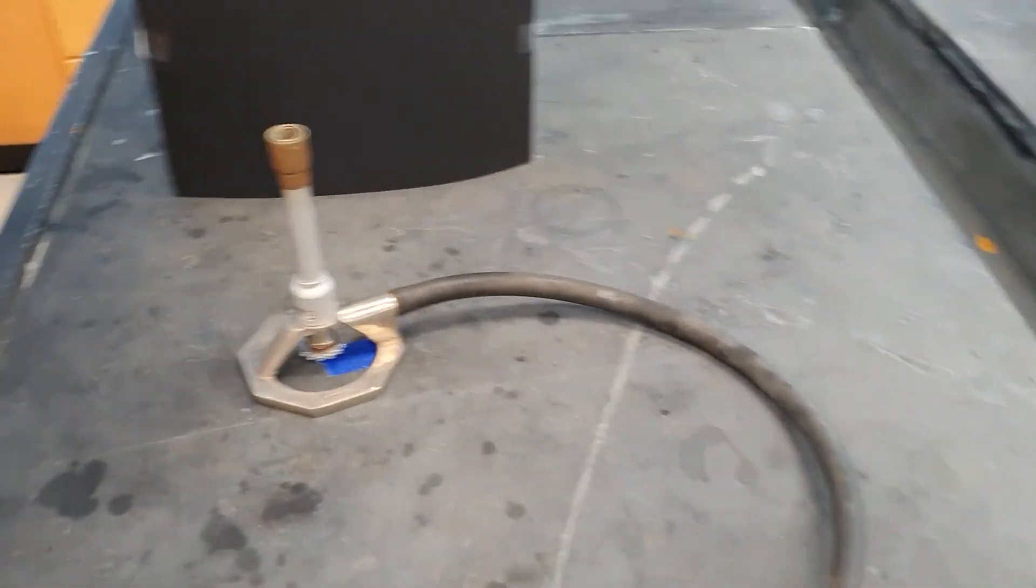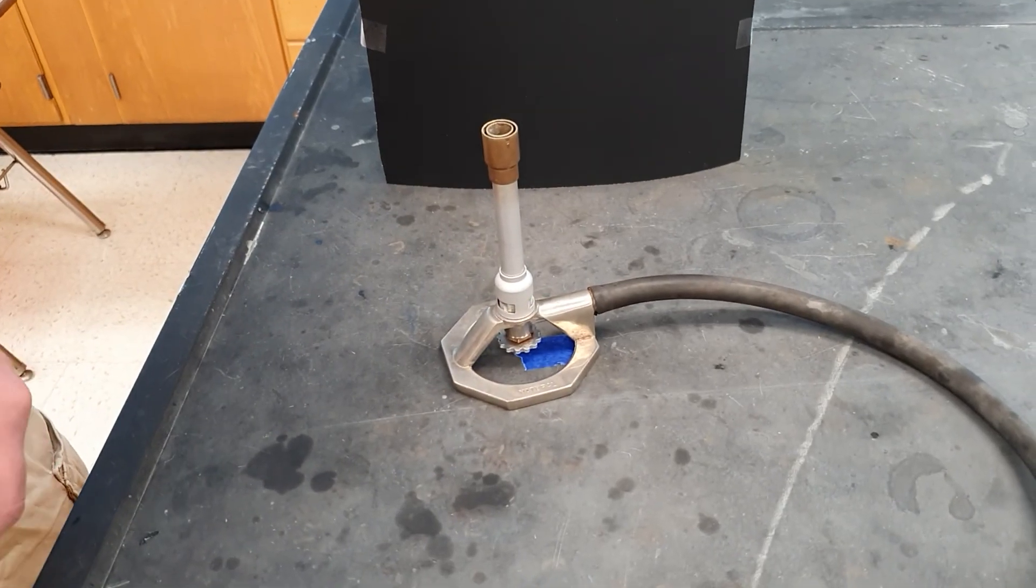All right, ladies and gentlemen, so there is your overview of how it is that you light and adjust a gas burner. Here we go.